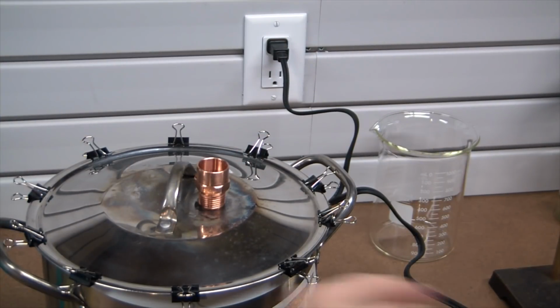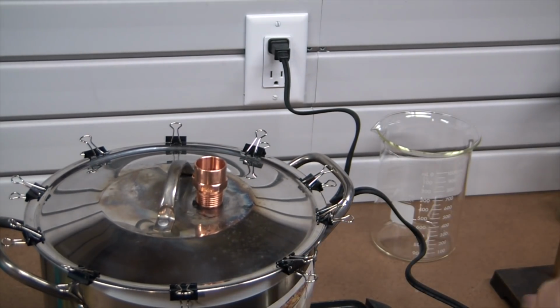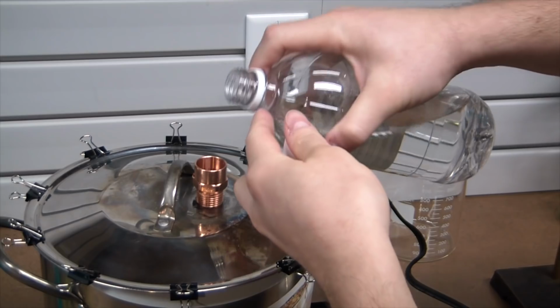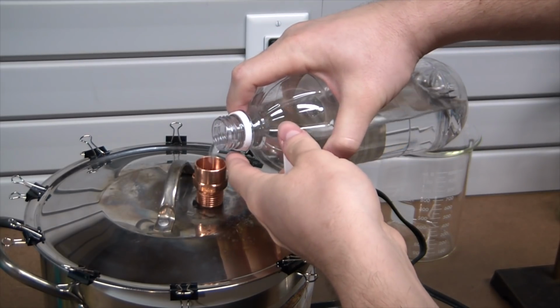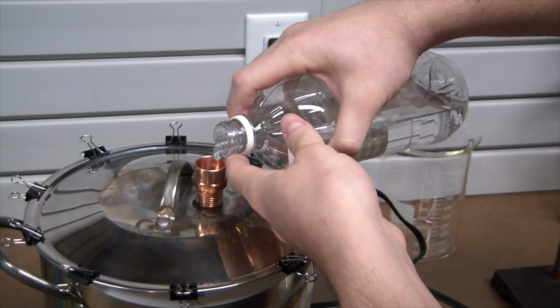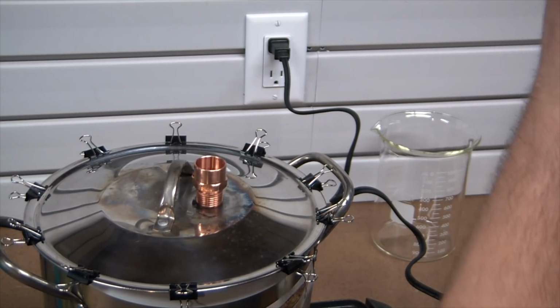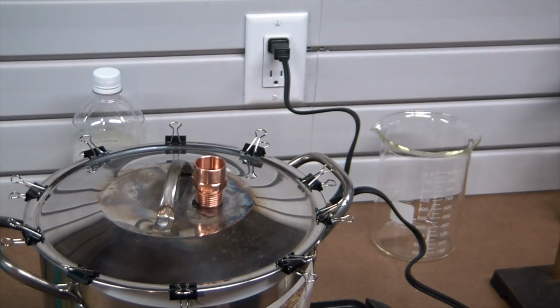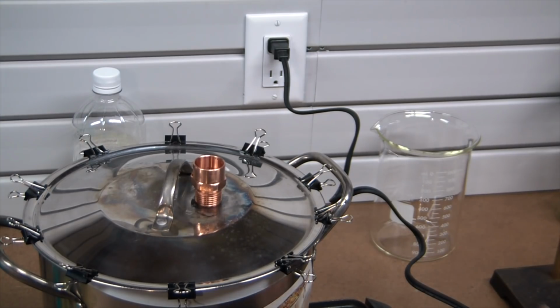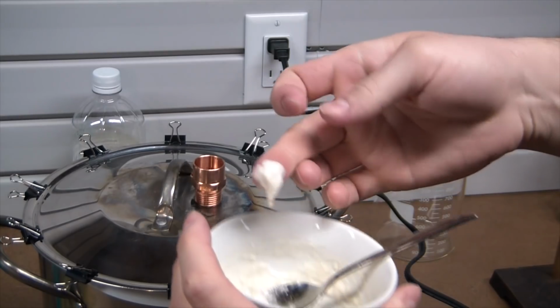Alright guys, so just put some Teflon tape around the rim there, sealed it up with some of these small clips. Add some vinegar. This will just help clean out everything for first run. I'll probably run this through a couple times, you know, fresh water and vinegar each time, just to make sure any contaminants are cleaned out of the glassware and or stainless steel vessel. Got some flour paste here, just nice mixture of flour and water.